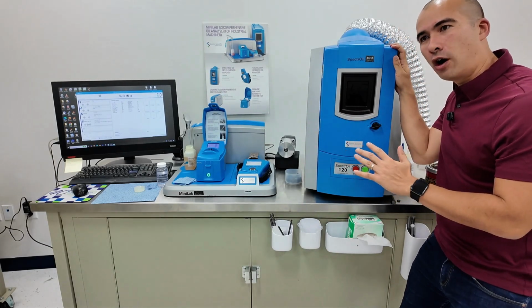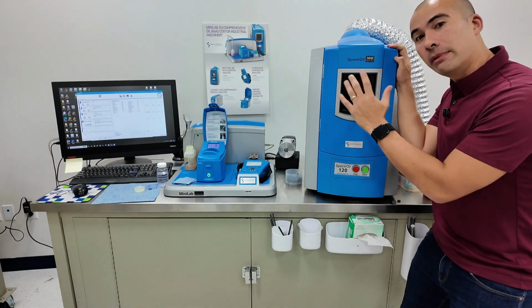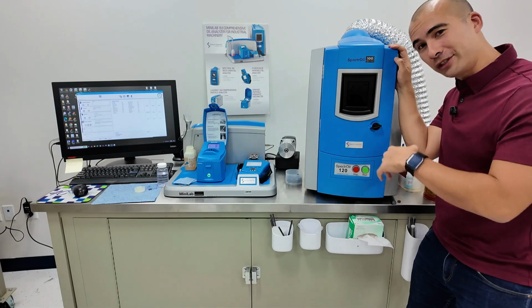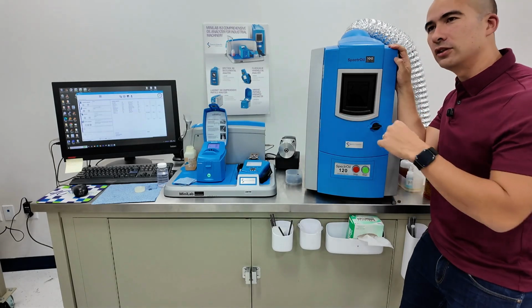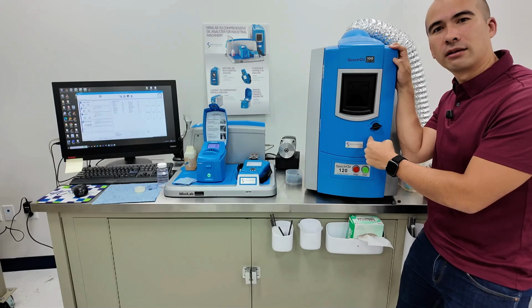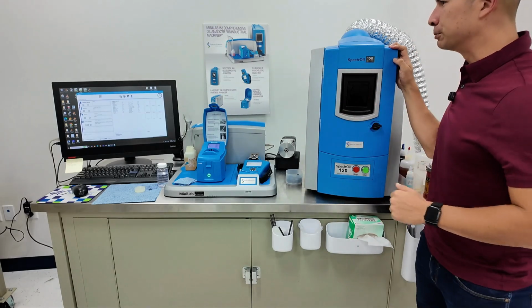It's slightly different from the typical ICP that you would see in a third-party lab, purely by the method of excitation. So in this instance, we are using the rotating disc electrode. In other methods, we are using plasma, and this one is arc. So a slightly different method, but more or less the same principle.